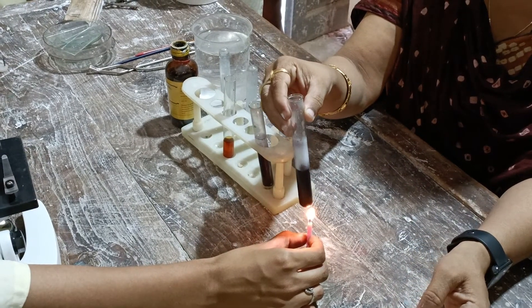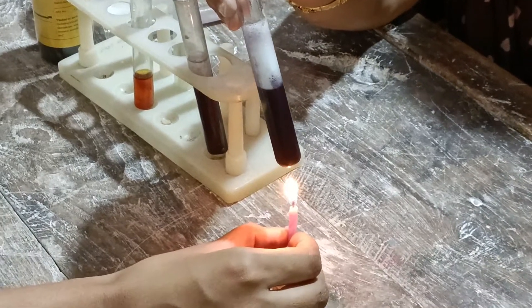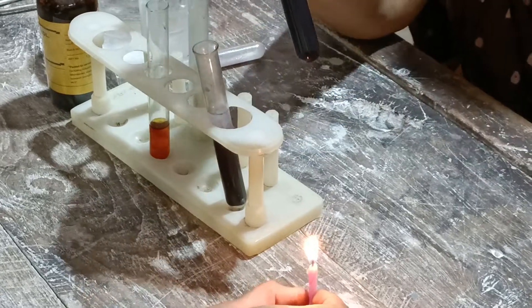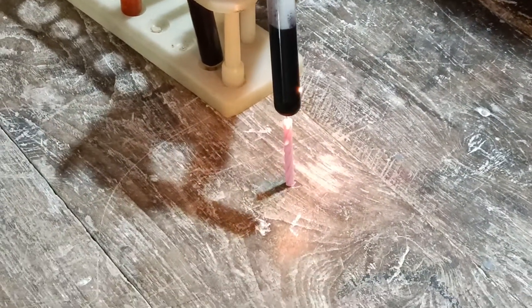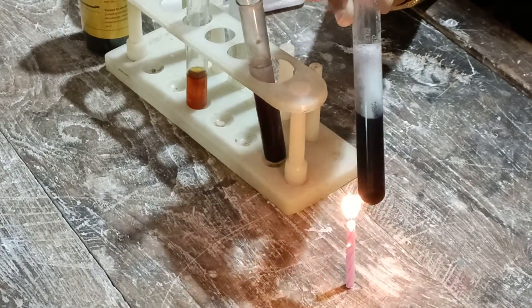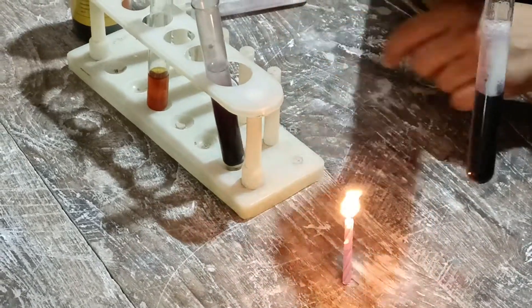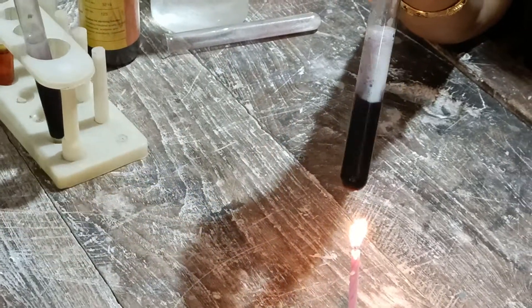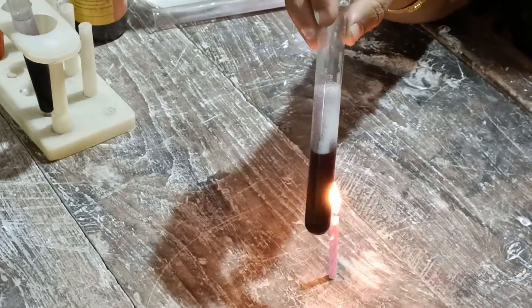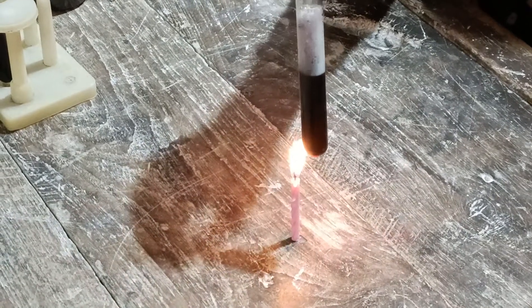We need a spirit lamp for this. Now we are heating the starch solution. In this, we want to get the starch solution heated so we can observe what happens to the enzyme when temperature is applied.